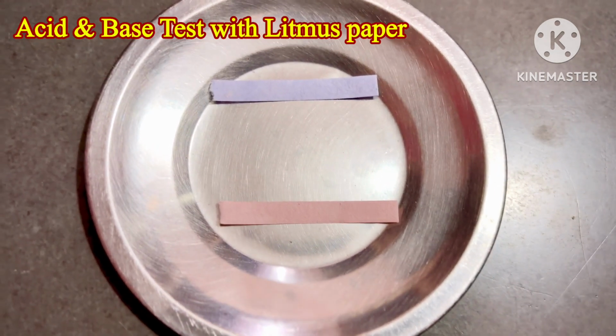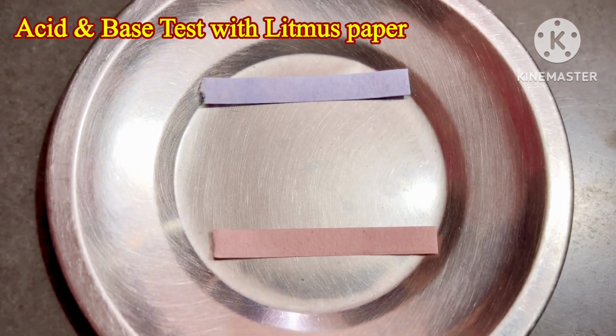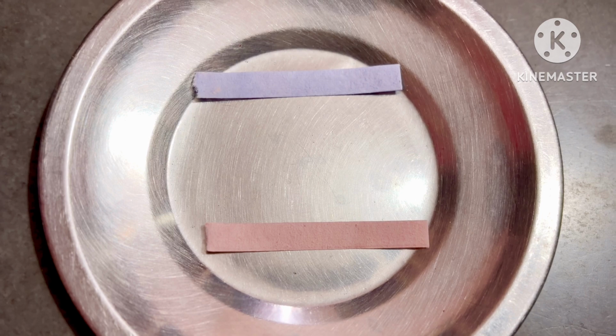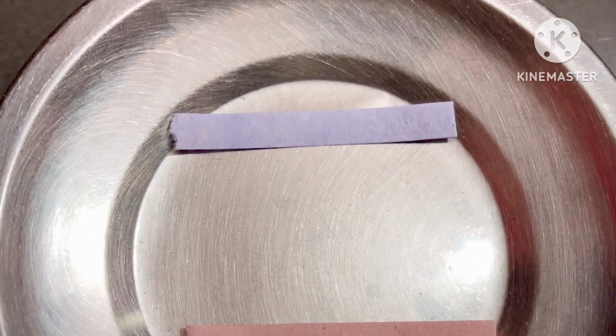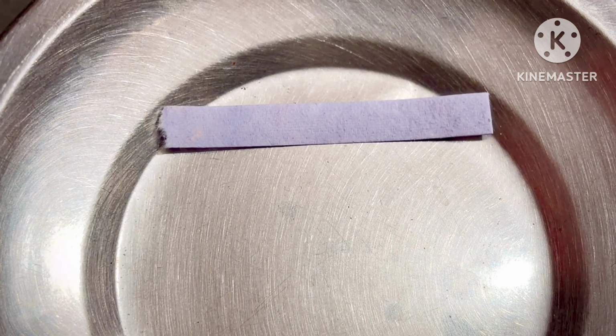Hello dear students, I am showing you the litmus paper. Here two papers are there, one is blue, another one is red. So you are looking at the blue litmus paper. So I am doing a test.